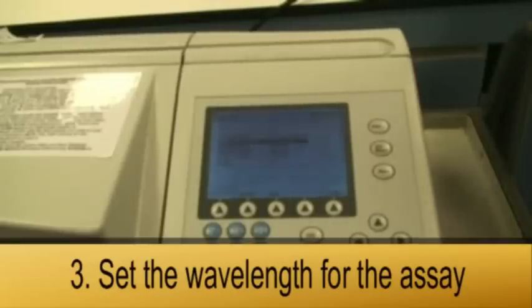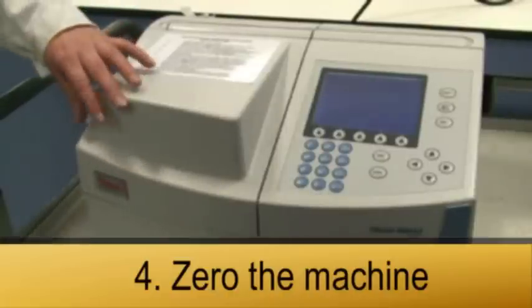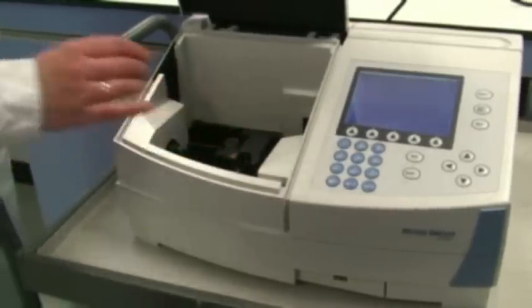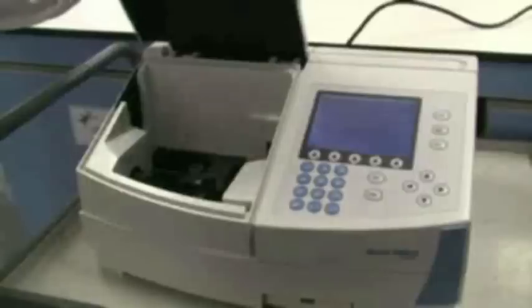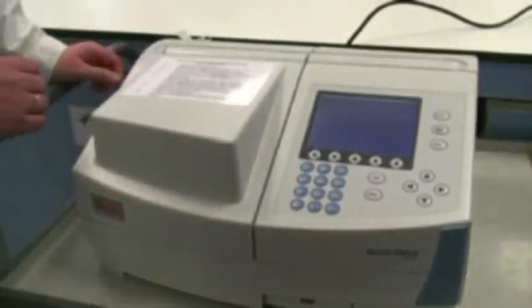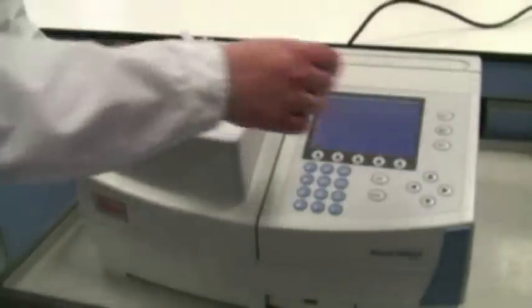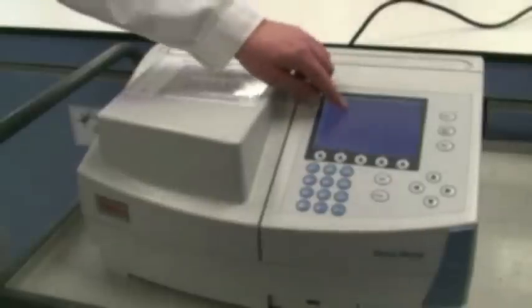To record your Bradford Assay results, you first will have to set the spectrophotometer at 595 nm wavelength. Before measuring your samples, you need to zero the spectrophotometer with your blank. Put the blank cuvette so that the light can pass through the clear side of the cuvette. In order to zero, you will follow the instructions on the spectrophotometer — press the zero base button and then another button, run, and wait for the results appearing on the screen.